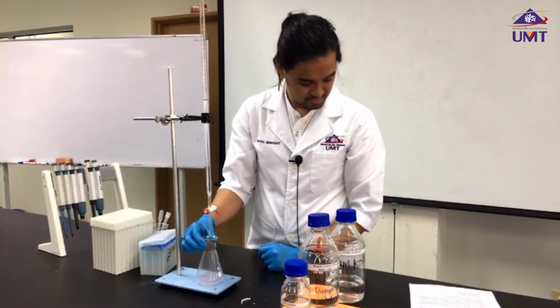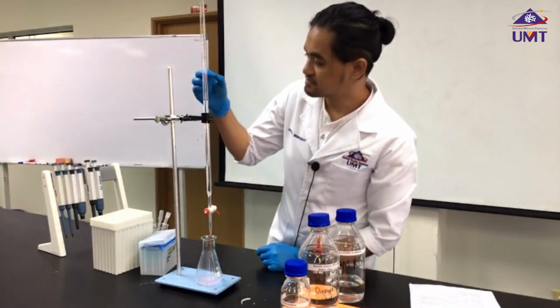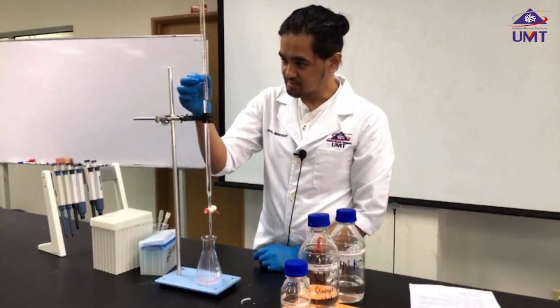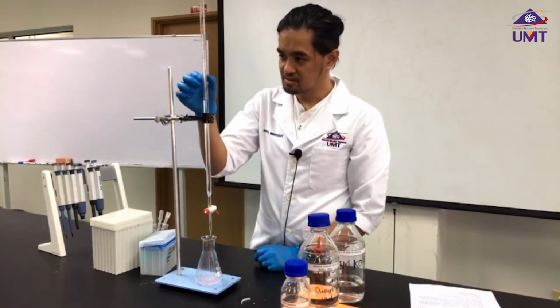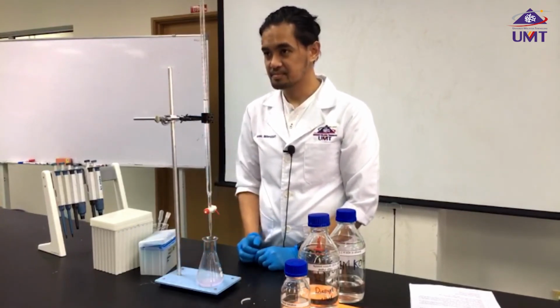So all we need is about 6 ml of potassium hydroxide to change the color.